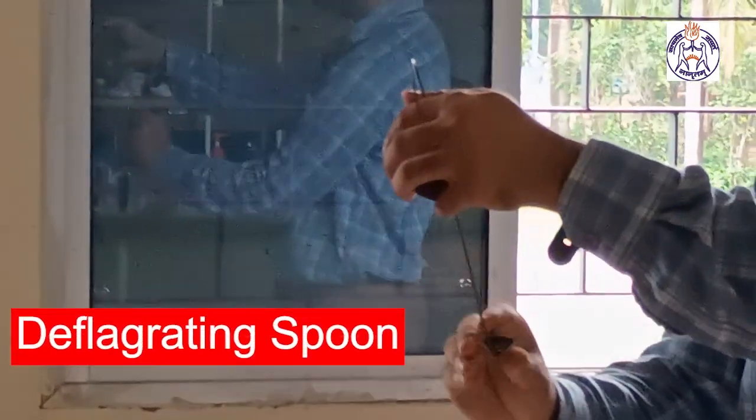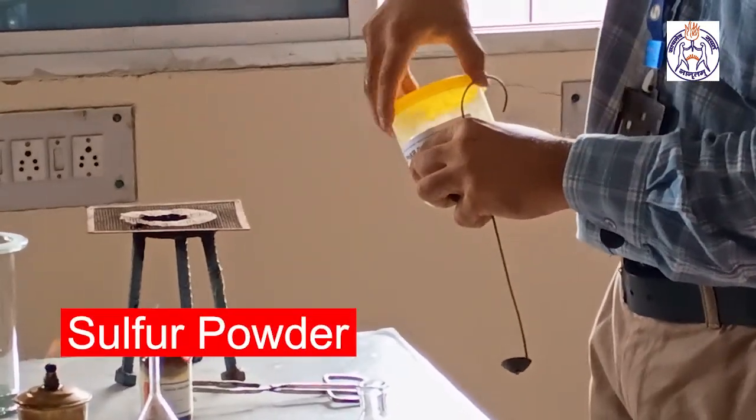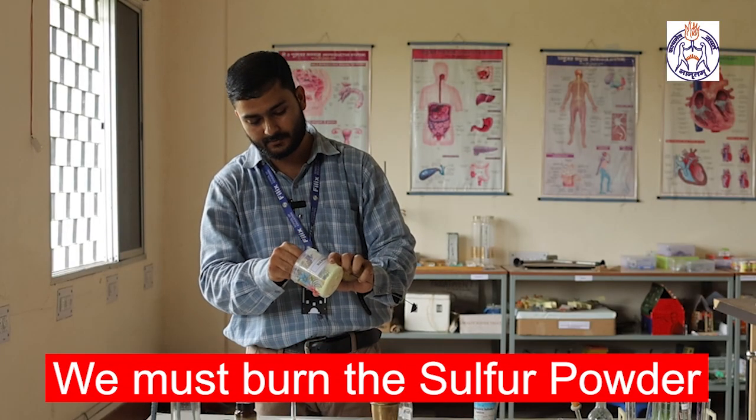This is a deflagrating spoon. Using that deflagrating spoon, I am taking sulfur powder, and we must burn the sulfur powder.